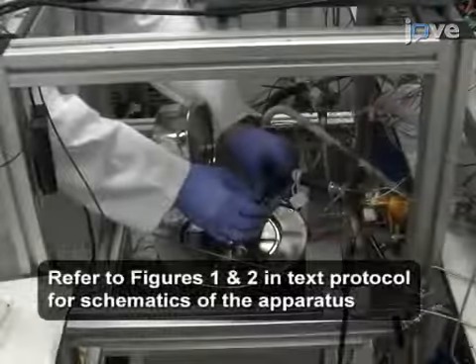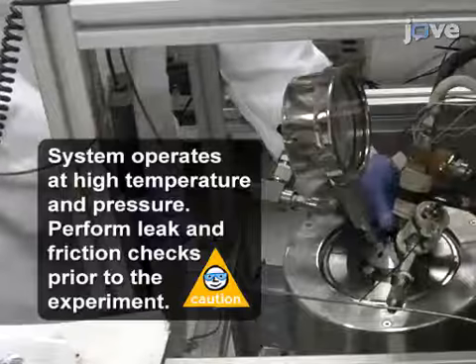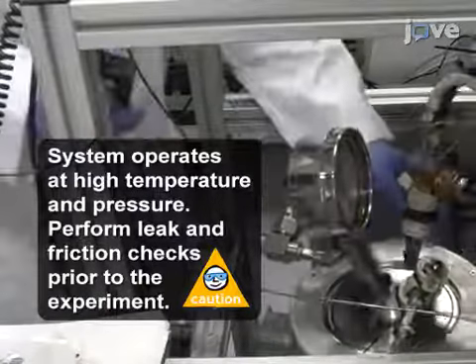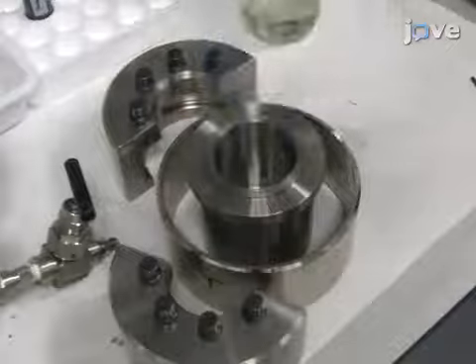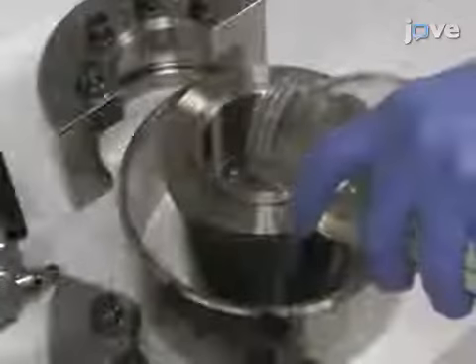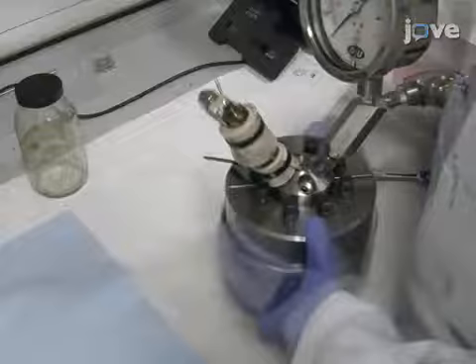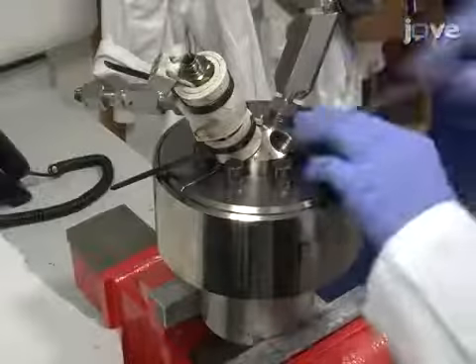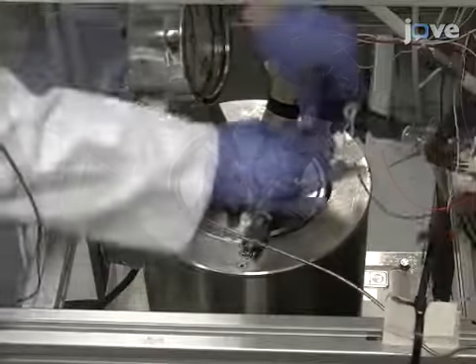To begin preparing the double gap geometry pressure cell system, disconnect and open the high pressure mixer. Load a stir bar and 200 milliliters of low viscosity oil into the mixer. Close the vessel with screws and reconnect the mixer.